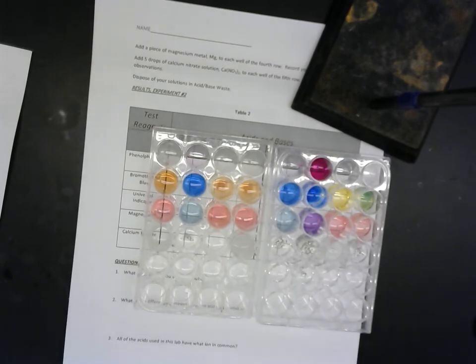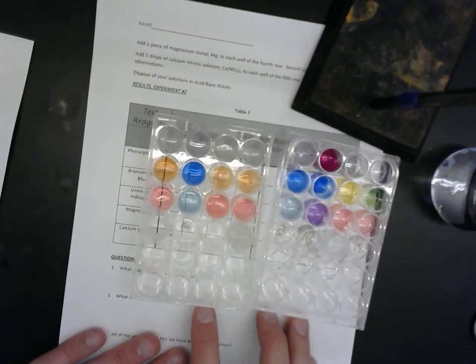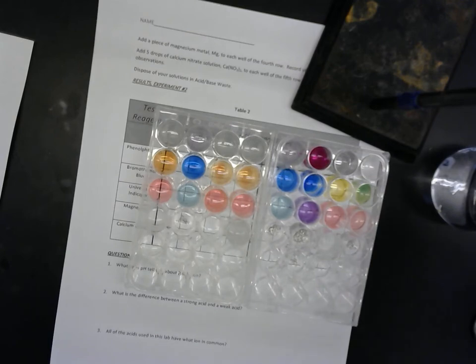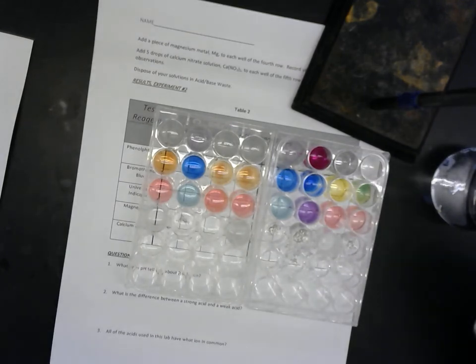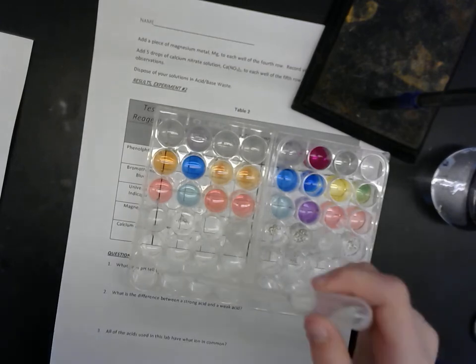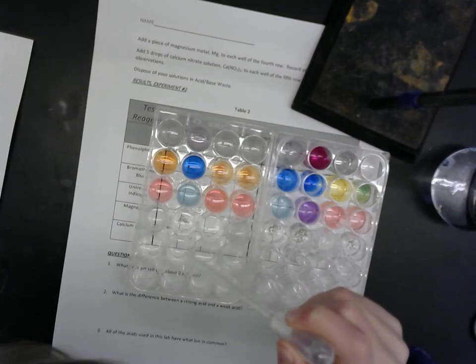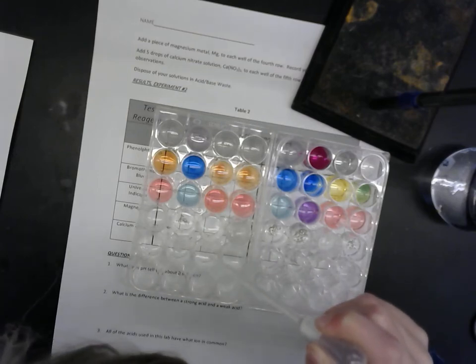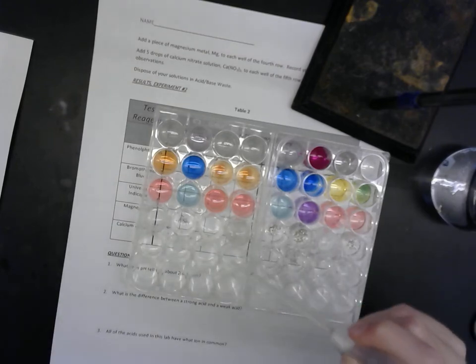And that is calcium nitrate. Is this calcium nitrate? Yep, that is calcium nitrate. So the last row here, Lily, can you put a few drops of calcium nitrate into each of the last row? Okay. So calcium hydroxide is actually only a sparingly soluble salt. And in basic conditions, the calcium hydroxide is going to form a precipitate. It's getting a little cloudy in that one, but that's all.